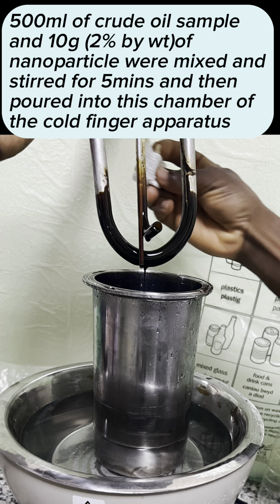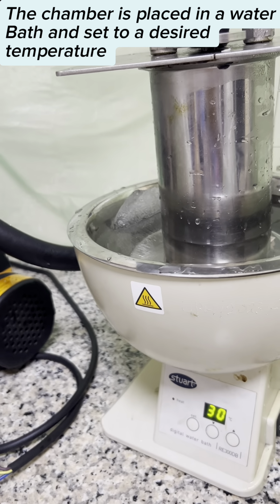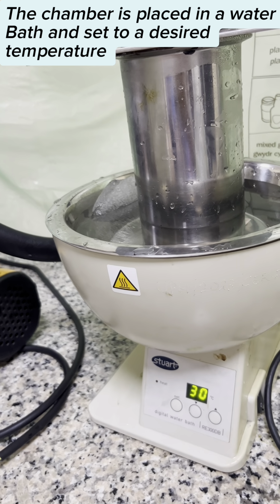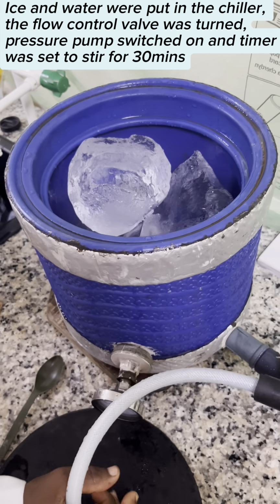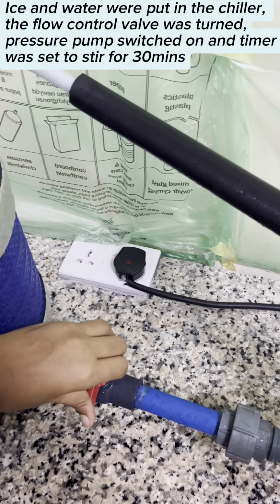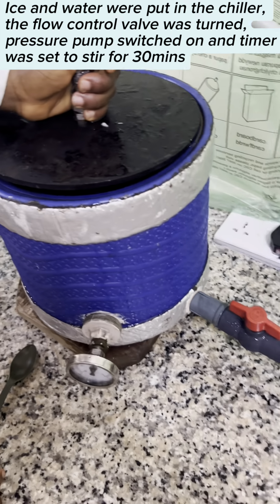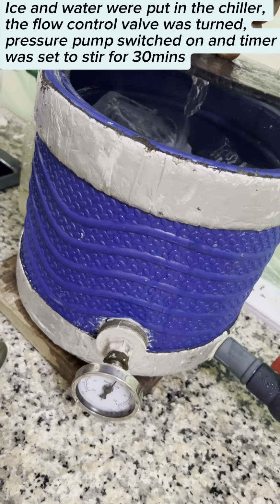500 ml of crude oil sample and 10 grams of nanoparticle, which is 2% by weight, were mixed and stirred for 5 minutes and then poured into the chamber of the cold finger apparatus. The chamber is then placed in a water bath and set to the desired temperature. Ice and water were put in the chiller, the control valve was turned, the pressure pump switched on, and the timer was set to stir for 30 minutes.